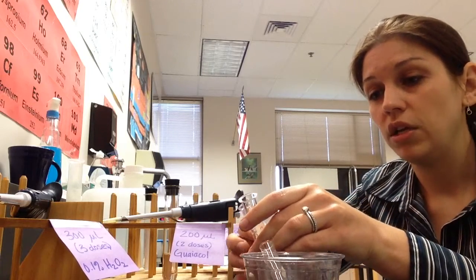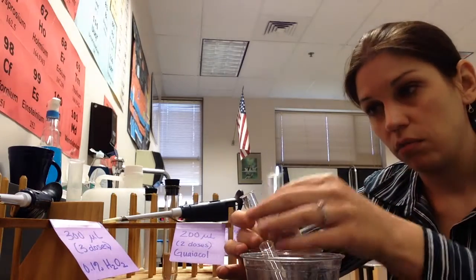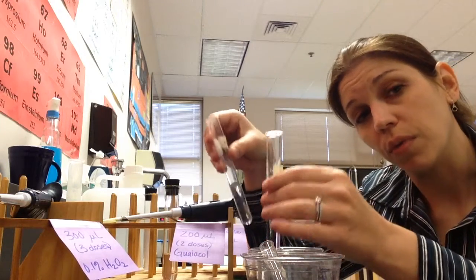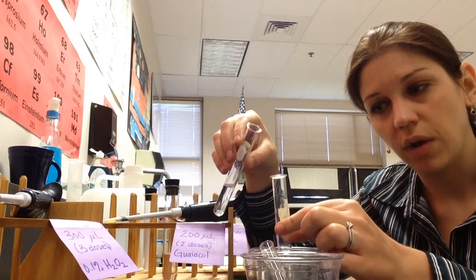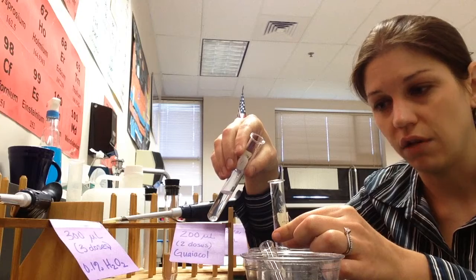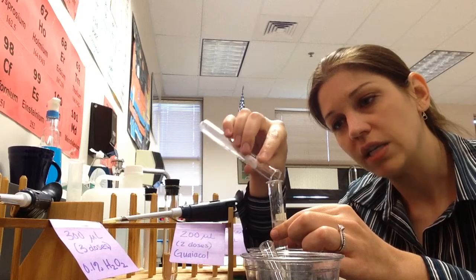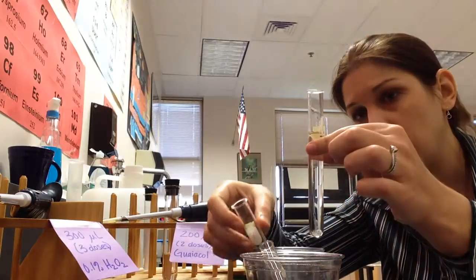When you have your test tubes, remember that you're going to have them in a rack. You're going to pour 1 test tube into the other. It doesn't matter which one you pour into the other. But by leaving this one in a test tube rack rather than in a cup, you have much less chance of spilling it on yourself, and it's just safer that way. So you take one test tube and dump it into the other. As soon as the contents meet, your reaction began, so somebody needed to start timing at that moment.